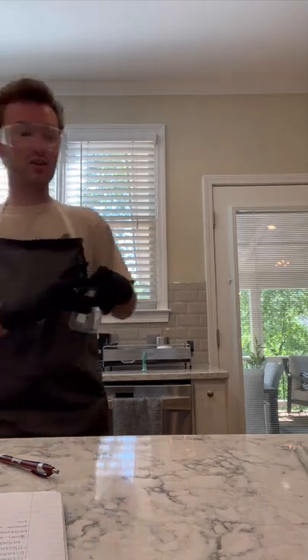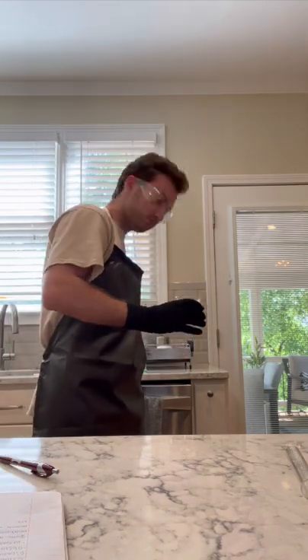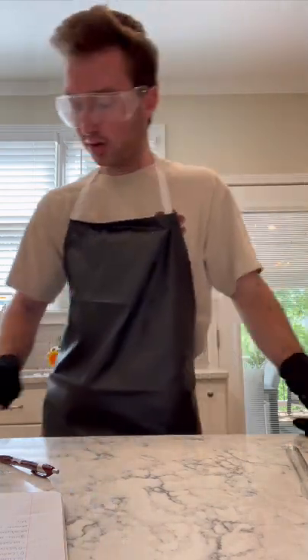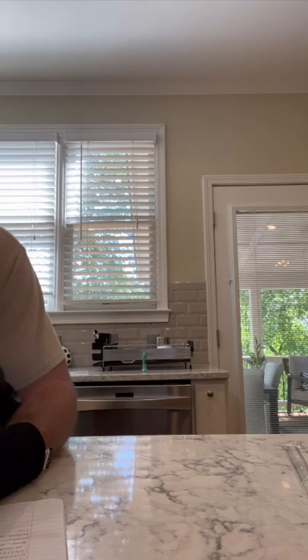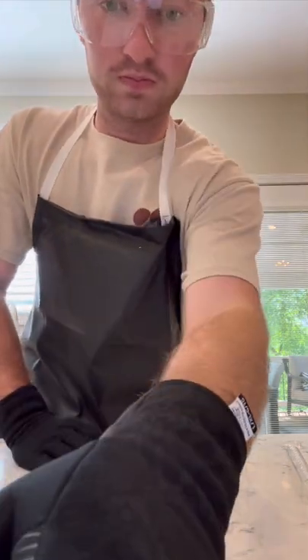With the beaker. The mass of the beaker, before we go ahead and get going, is 100.65 grams. So using that, my liquid is 102.31 minus 100.65, 1.66 grams. And that's my first reaction. We'll be back for the second one.